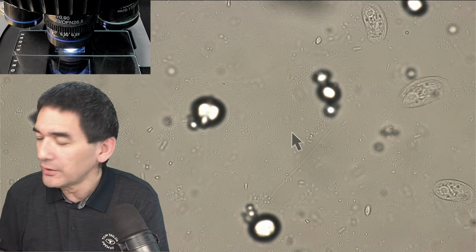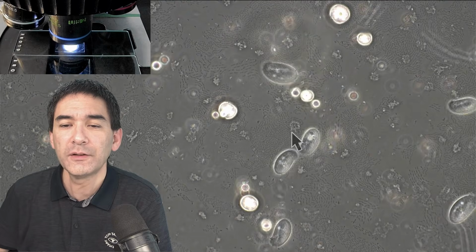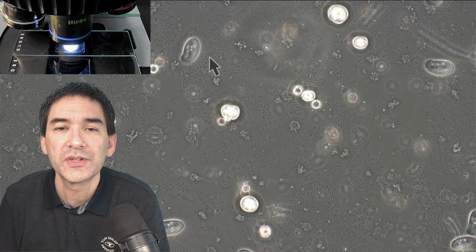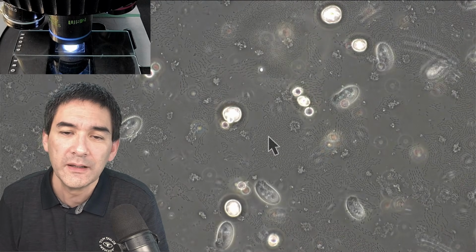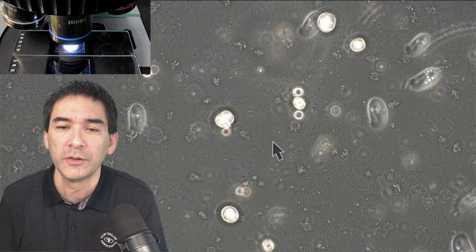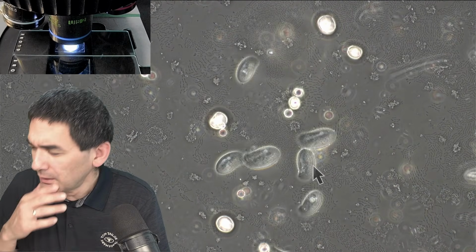So what I'm going to do now is switch on phase contrast. I'm going to rotate the objectives over, and also have to change something on the condenser here. I open this here, and this is now phase contrast 40 times. And now you can actually see that phase contrast allows you to see those bacteria much better because they're darker, right? Not everyone's got a phase contrast microscope, and the disadvantage of phase contrast is you're kind of losing a lot of color this way. But under some circumstances you're able to see things that you're normally not able to see. And look how bright the starch grains now look, right? That's quite nice.